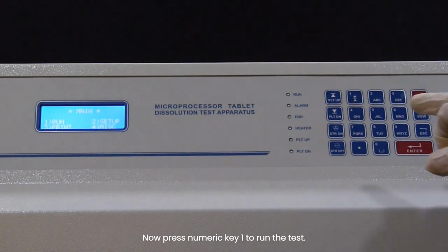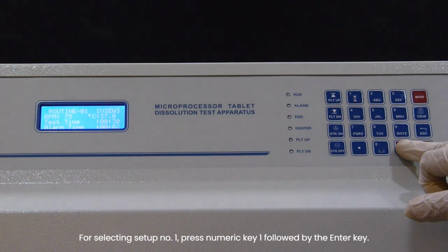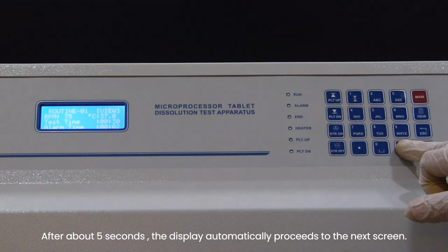Now press numeric key 1 to run the test. Using the numeric keys, enter the setup number and press the Enter key. For selecting setup number 1, press numeric key 1 followed by the Enter key. The instrument will flash the parameters of the setup chosen for the current run mode according to the mode selected. After about 5 seconds, the display automatically proceeds to the next screen.